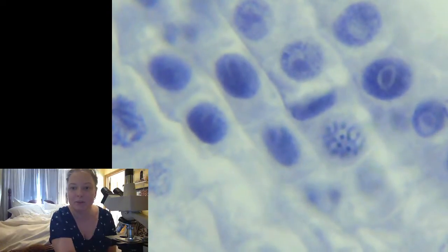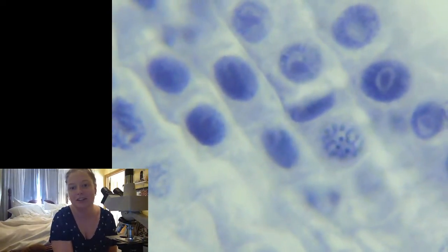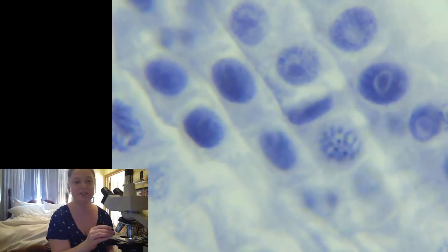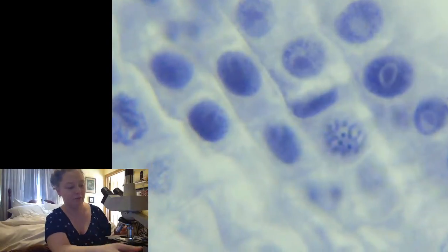So I just thought that one might be kind of interesting to us, because we had just done some mitosis. So let's pull back out of there. Get ourselves reset.